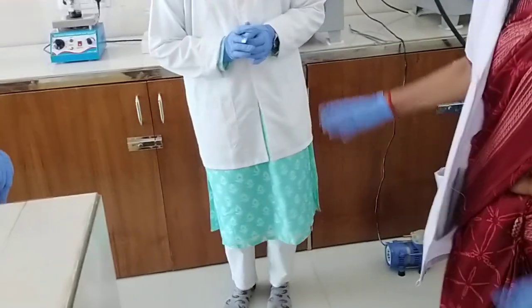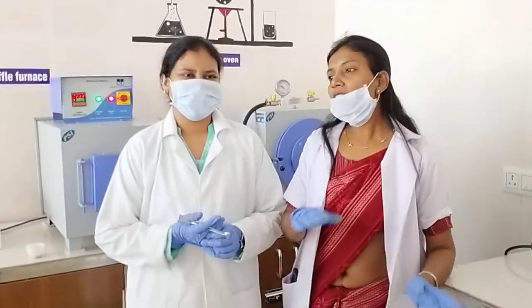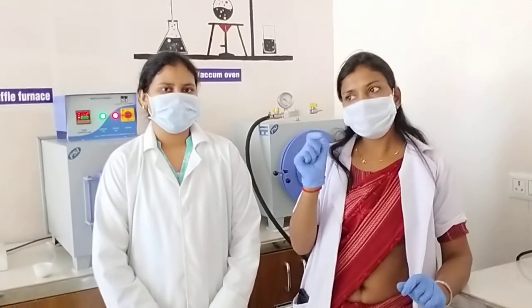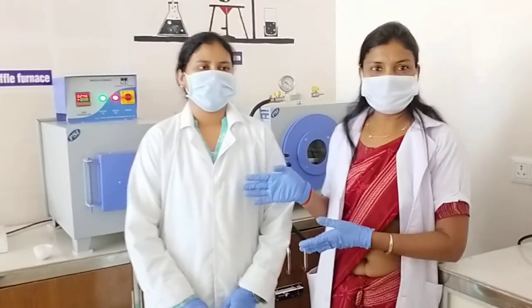Actually, sulfuric acid is very hazardous. So while doing this kind of experiment, always take precautions. Sometimes we think, it will be fine, let it be. No, even one small mistake can give you a problem. And right now we have an example for that.